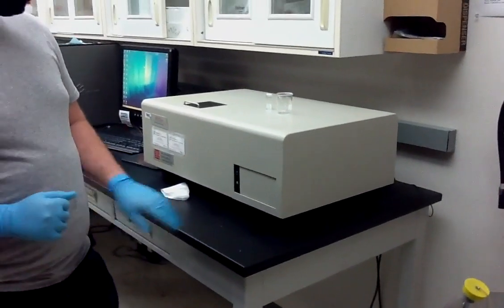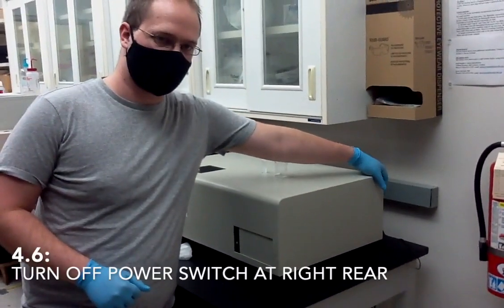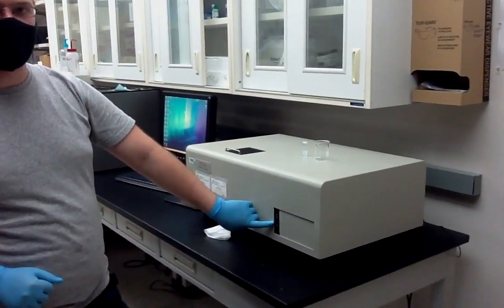When you're done doing all your experiments, double check the power light is on again, then come back and turn off the power switch, and you'll see the power light turn off.